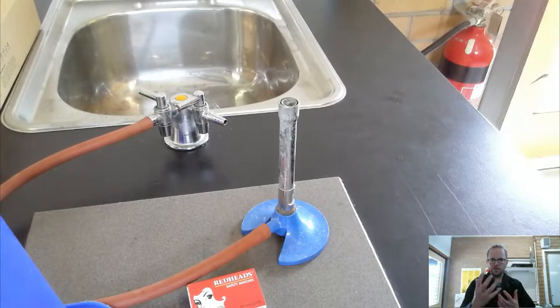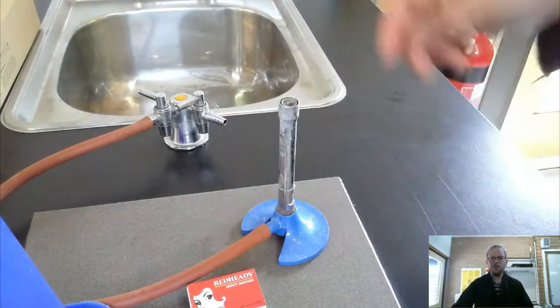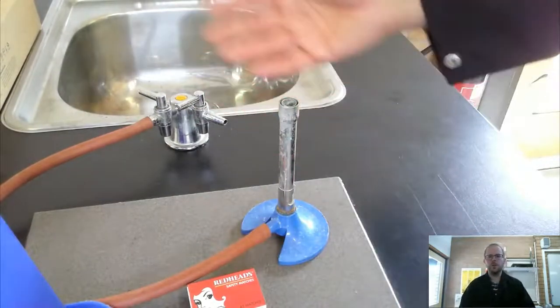You can see that I've got the camera that's filming me so we can speak together and I can teach you some things, but also that I've got a webcam set up just down here to film the Bunsen burner and the equipment that I'm going to use.